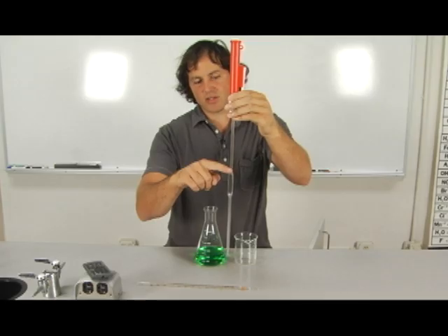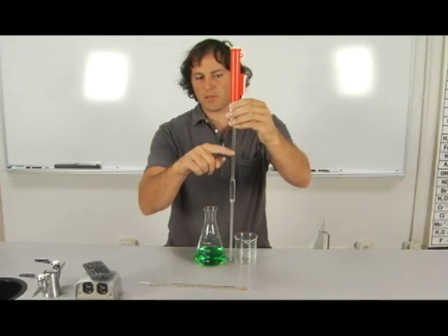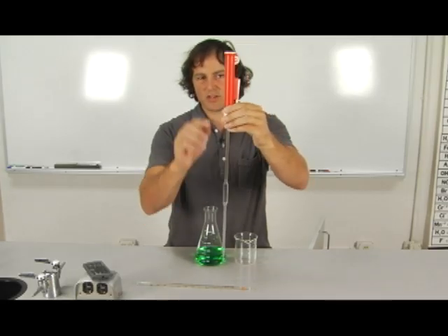But the second it hits this narrow section again, it has a tendency to move very quickly and students who have never used this before end up shooting up into the pipette. So as you reach the top of this bulb section, slowly pull the rest of the way out.